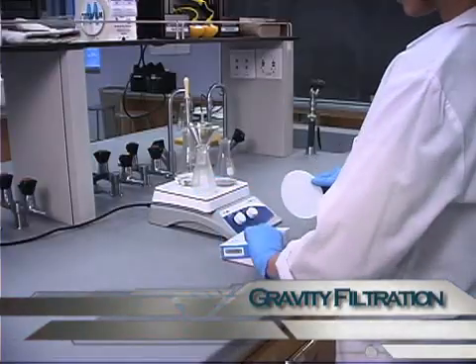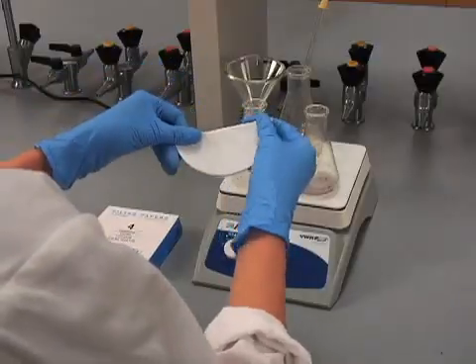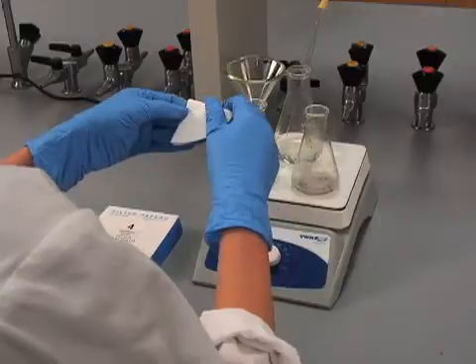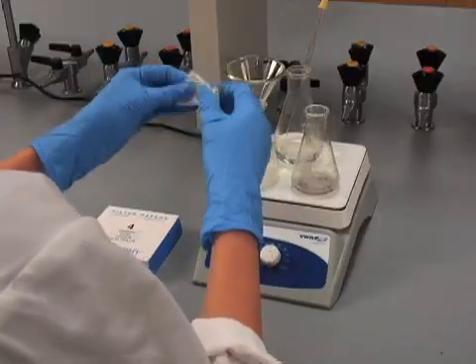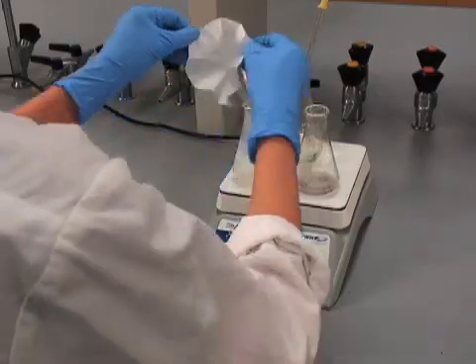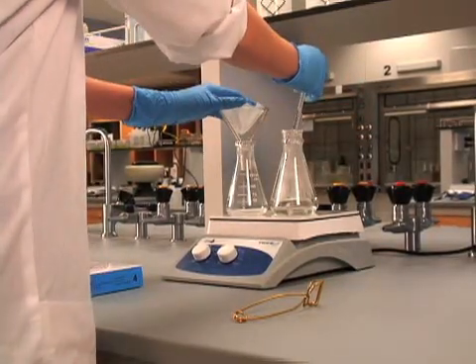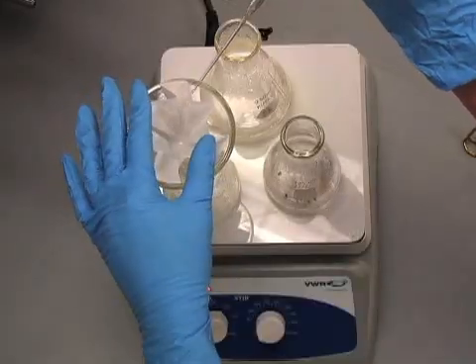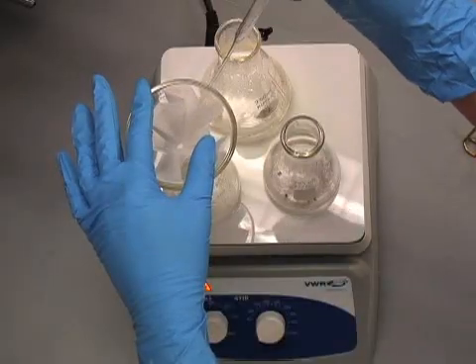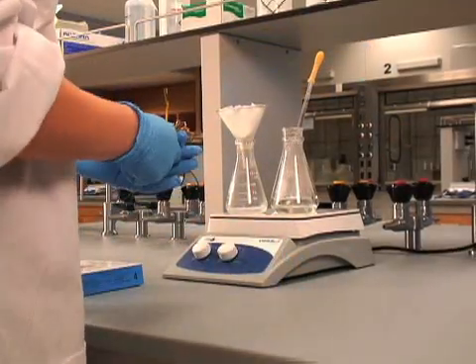At this point, we need to filter out the insoluble impurities from the solution while keeping the solution hot. To speed up the filtration, we fold the filter paper to increase the surface area of filtration. It is crucial to keep the entire filtration system hot to prevent premature crystallization. To do so, add a small amount of hot solvent to keep the filter paper in place. With the system on the hot plate, the solvent added ensures it remains hot.